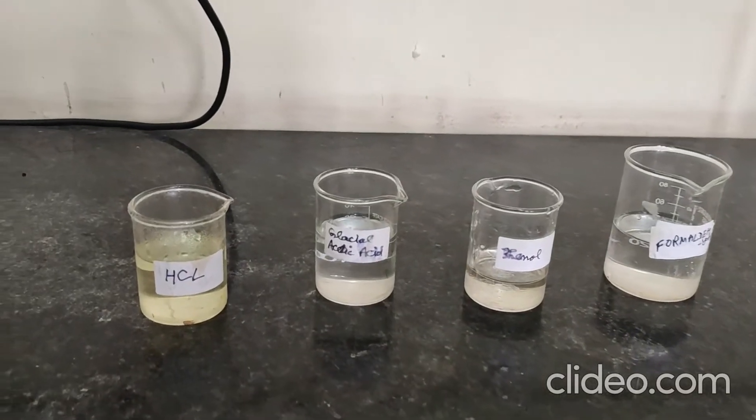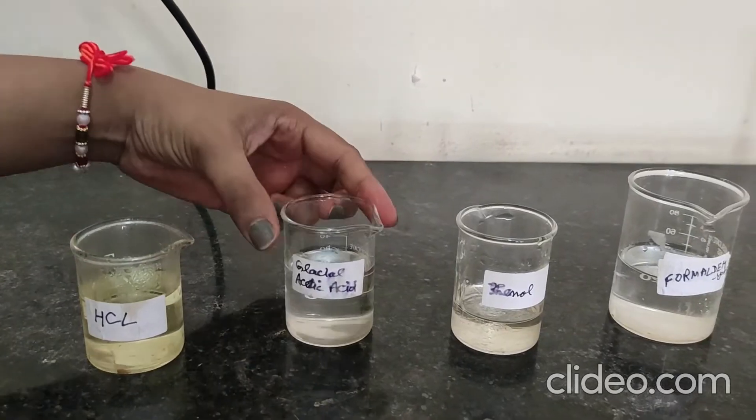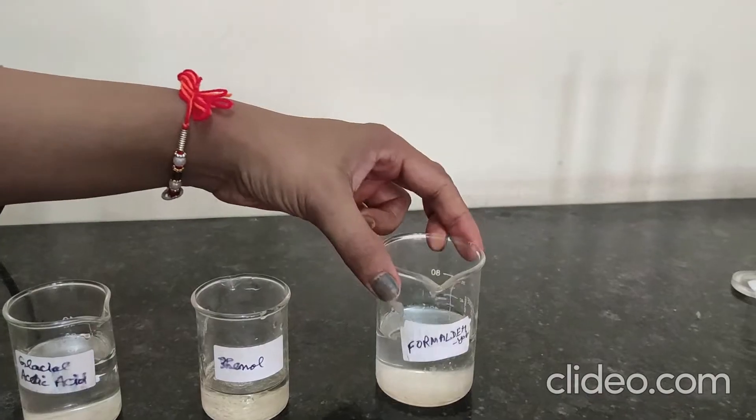So these are the chemicals. First is hydrochloric acid, glacial acetic acid, phenol, and formaldehyde solution.